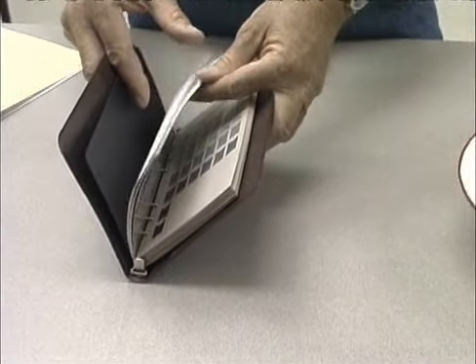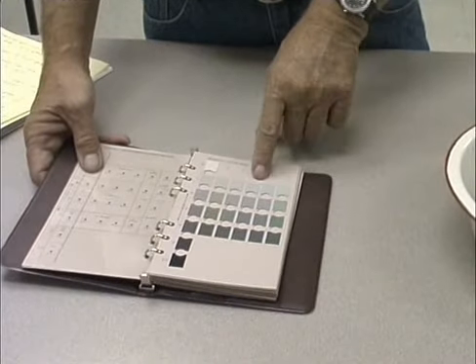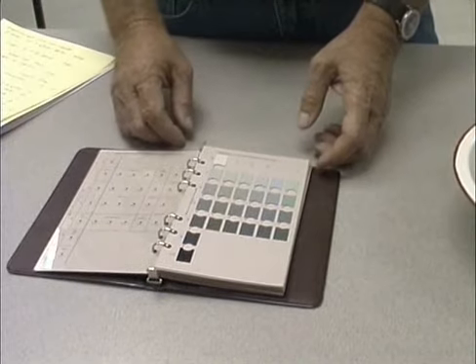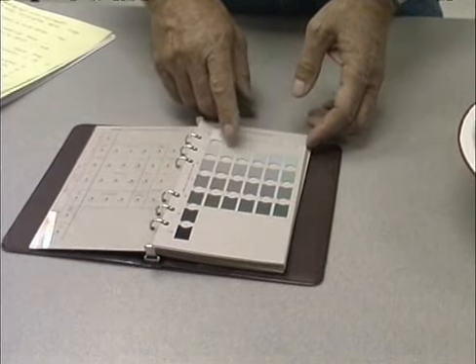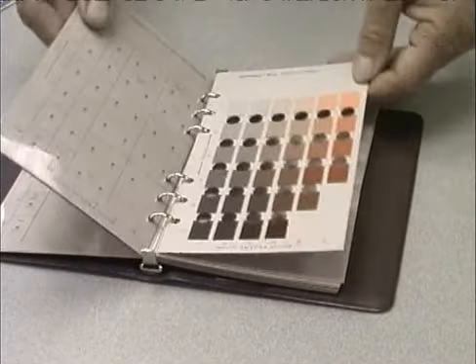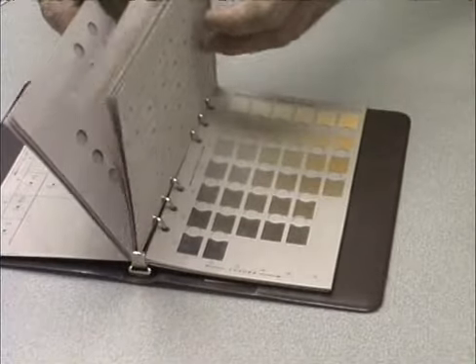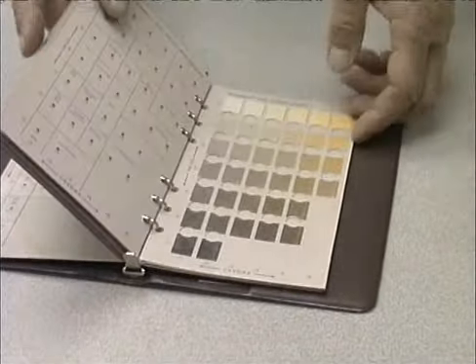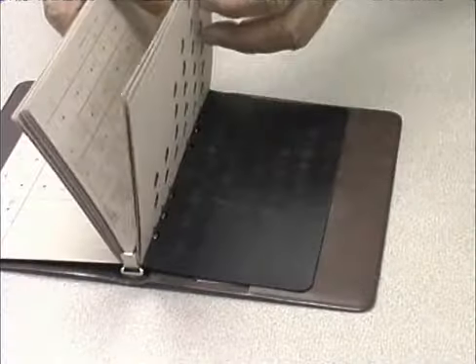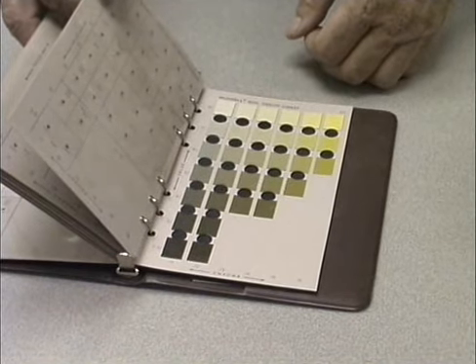other than introductory information here at the beginning, we'll notice it starts out with a series of color charts. These color plates run from a very gray or greenish gray color through a series of ranges, becoming more brown or yellow-brown in color, and finally into those where yellow predominates, ending with those that are very yellow or even yellow-gray in appearance.